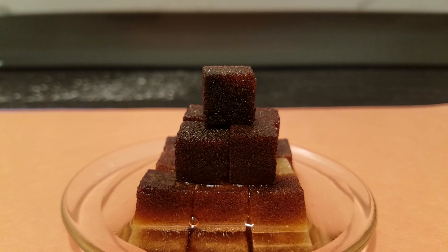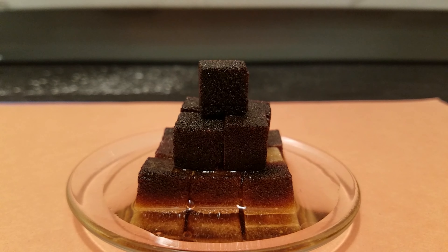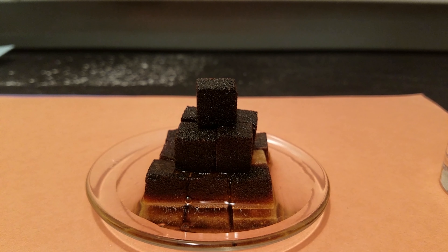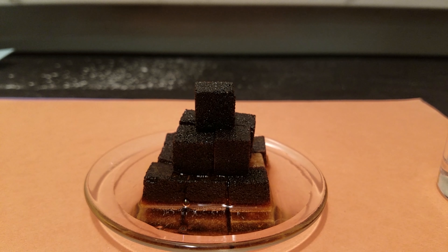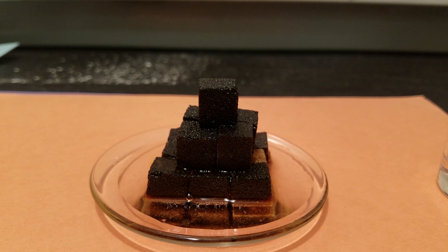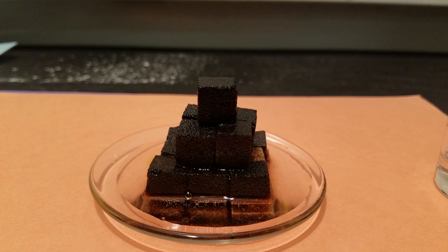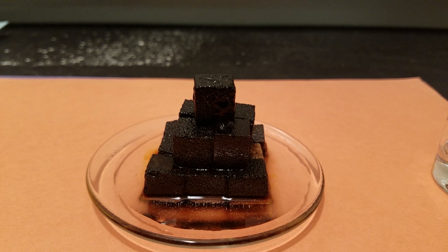As you can see, the sugar is turning brown first, and approximately 20 seconds later it's going to turn black. The sulfuric acid I am using is almost 100% concentration — I think it's around 98% purity. As you can see, the sugar cubes are turning black.